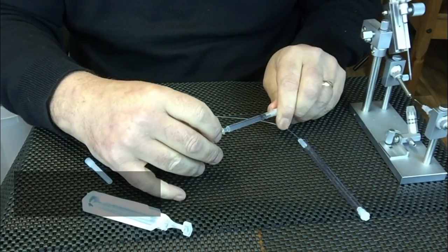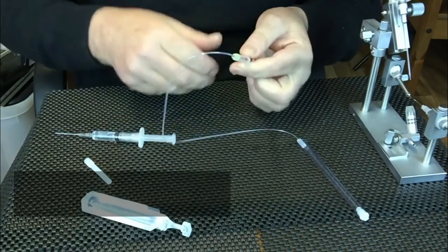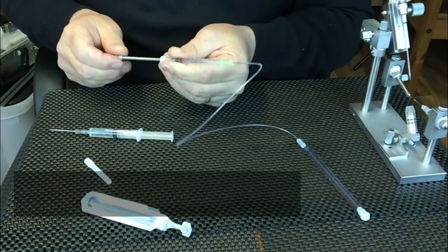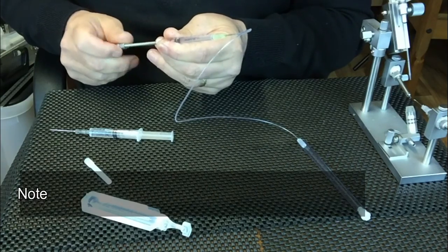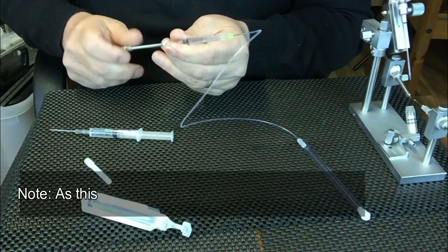You can connect the end of the lower adapter and drive some saline all the way through to the end.